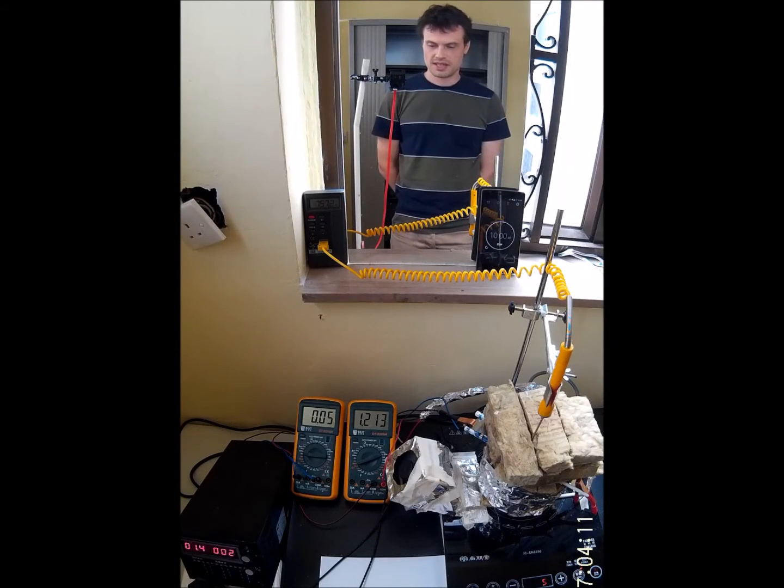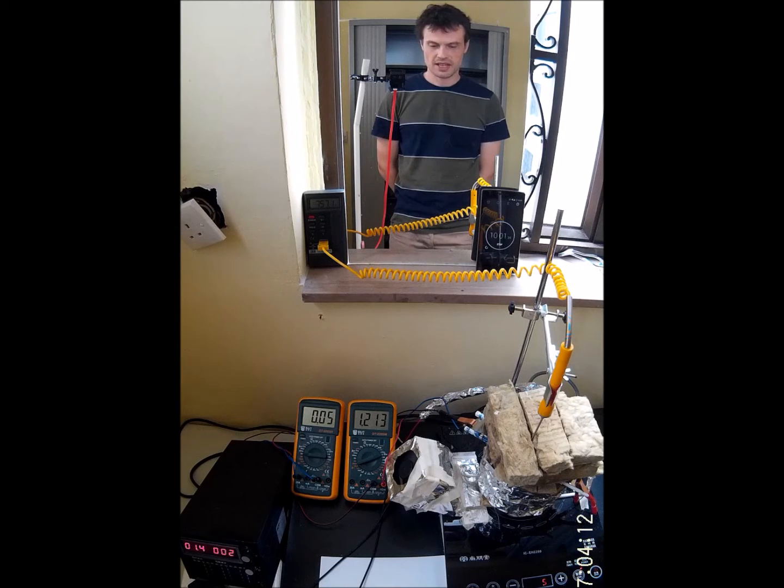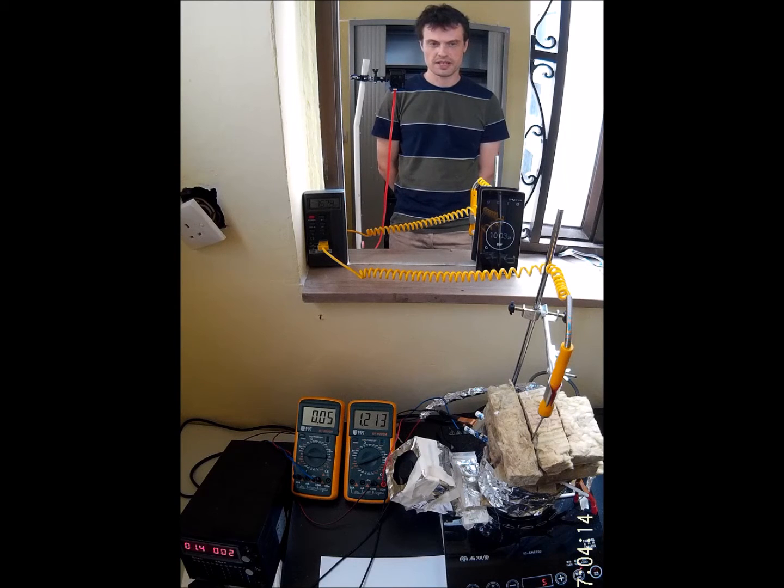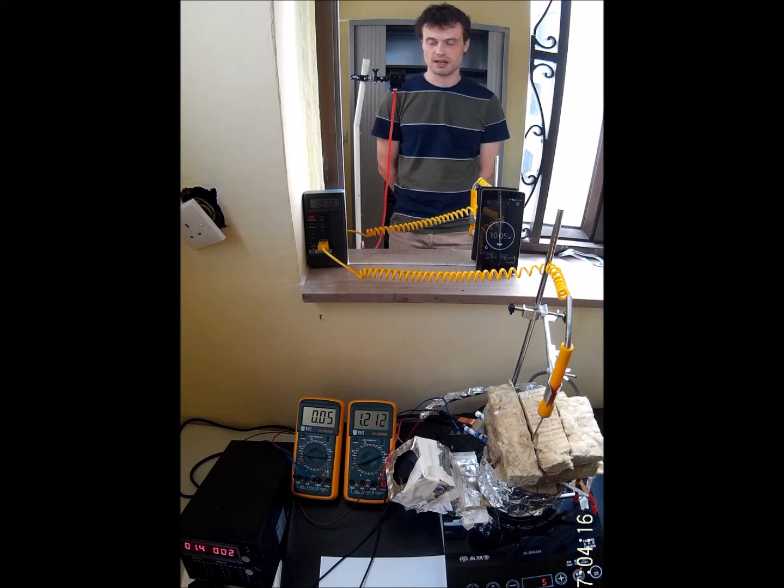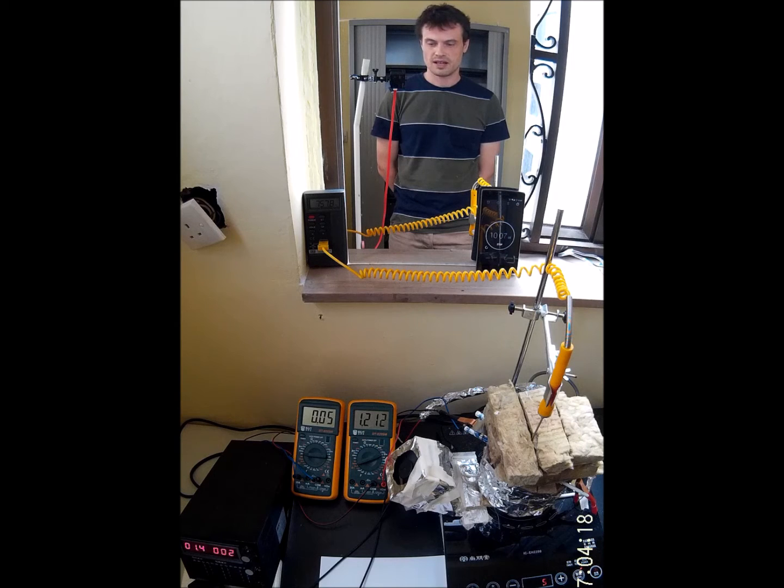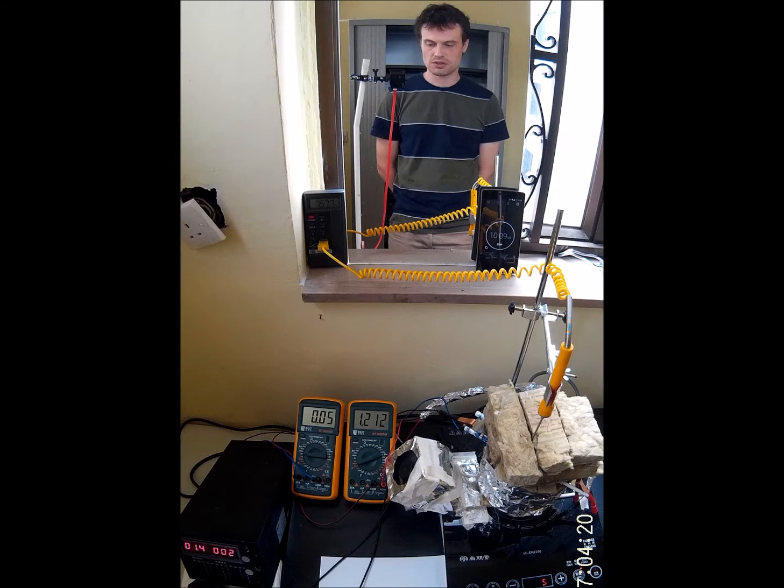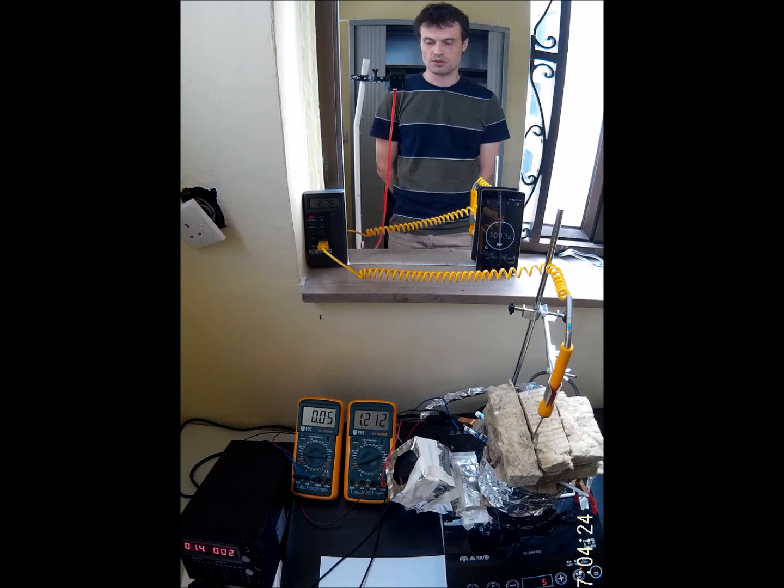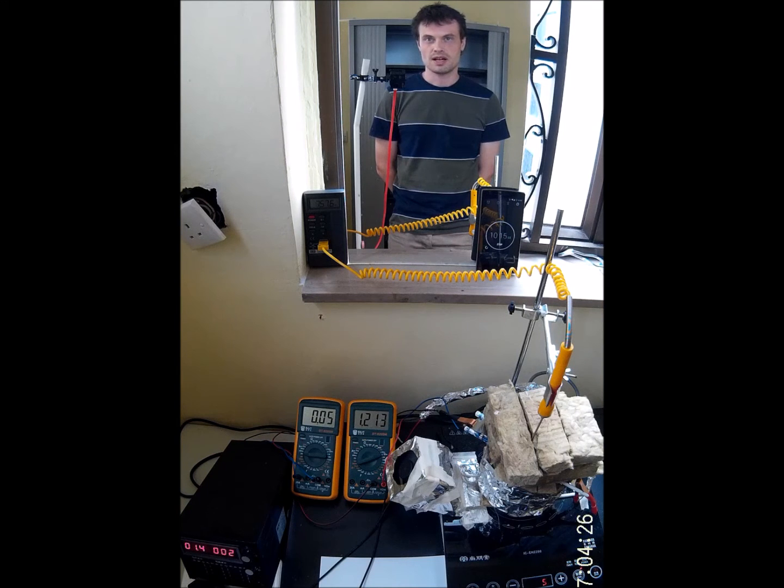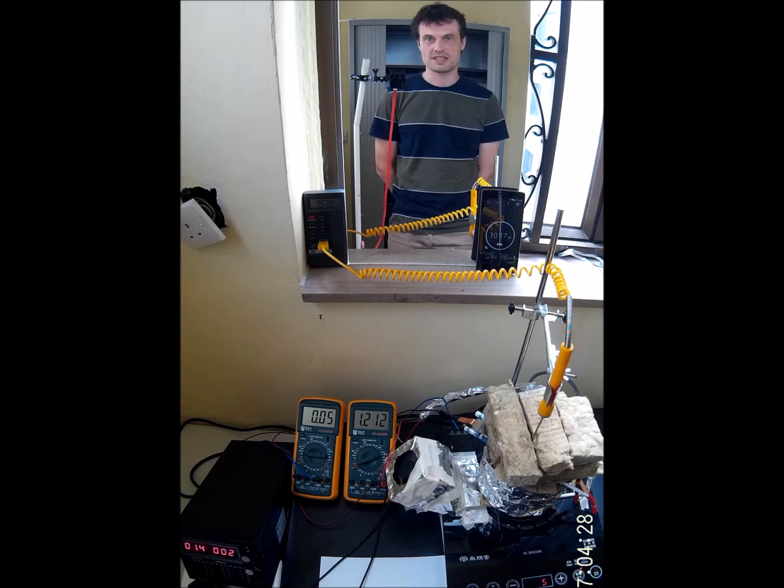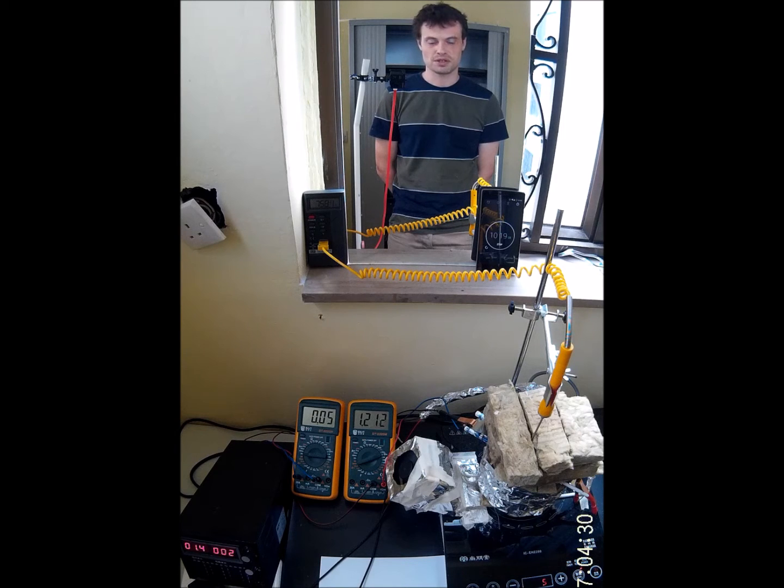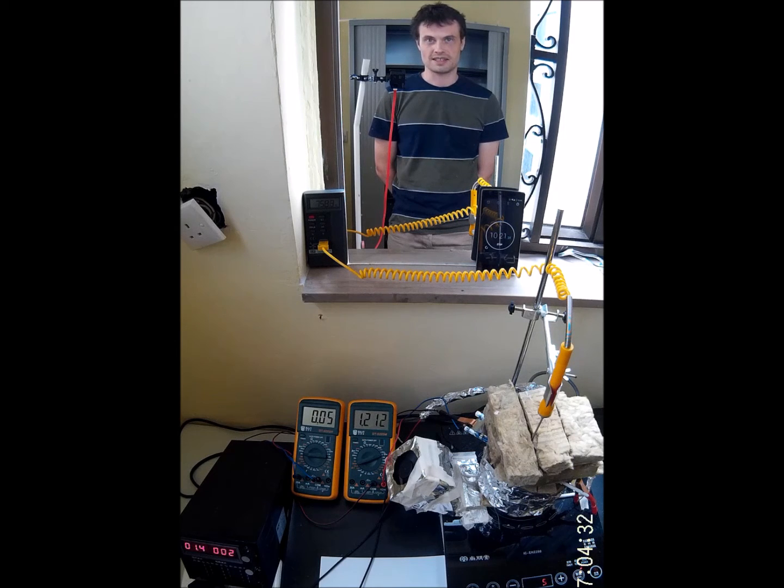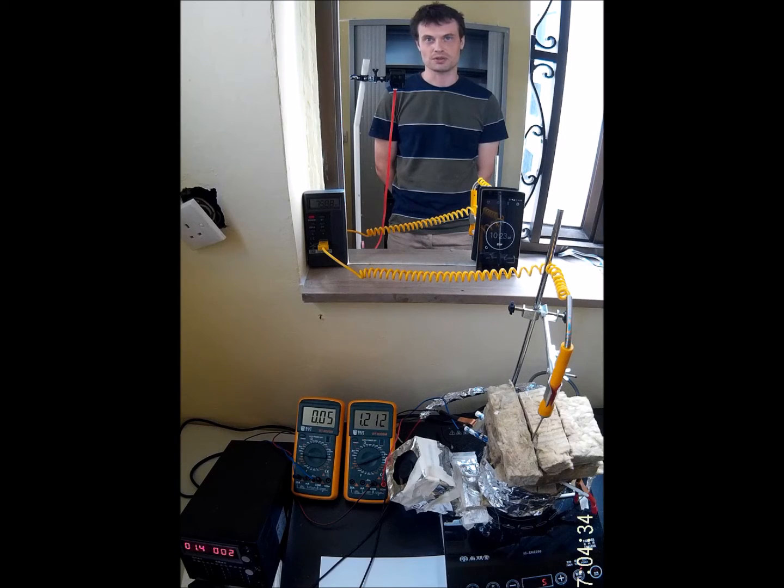Now I've had the electrolysis on for 10 minutes with low current. Next I'm going to raise the current bit by bit to 1 amp, and then I'm going to let it simmer for 2 hours. Let's see how it looks afterwards.